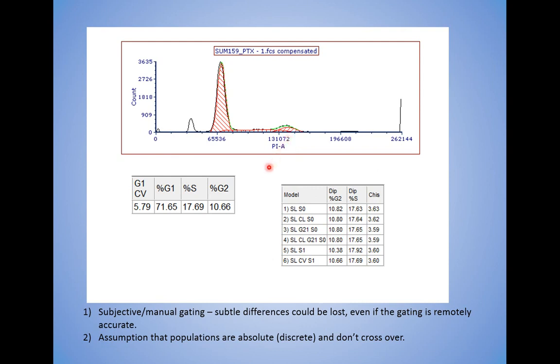Now, I know there are other resources out there on DNA cell cycle analysis. Multi-cycle in FCS Express has 6 different models, and you're supposed to actually do your main control file and choose the model that has the lowest chi-square so the data is as clean as possible. That's what I do, and I will check it with the control, and then run all of the tubes in that experiment with that model. If you've got 12 tubes, don't run 1 through 4 with this model, and 5 through 7 with this one, and 8 through 12 with this one. No, just keep it all the same model. It's the best assumption you can make.